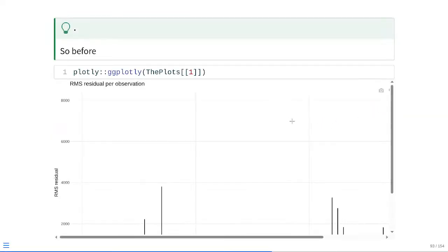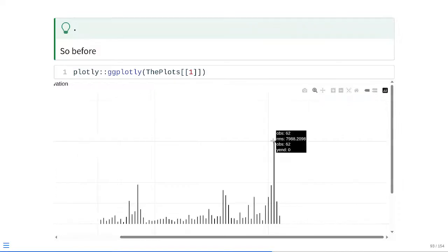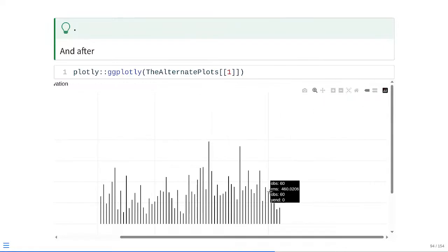And then at that point, if we remember our before, and this is a little plotly interactive plot, so give me a second as I zoom out. If we remember before we remembered to include Zombie NIR, we had residuals that were pretty high on detector 62, around 8,000 for the RMS. But if instead we had remembered to include Zombie NIR, if I zoom out, for that 62 detector, you can see it's substantially reduced in terms of its residual. It's down to 300 something. So all that massive amount of signal is now being accounted for correctly. And the leftovers are more in a couple other areas, as far as whatever peak detector 50, 39, and 6 are respectively.